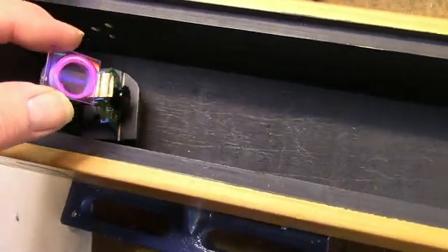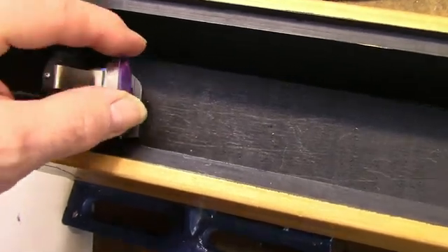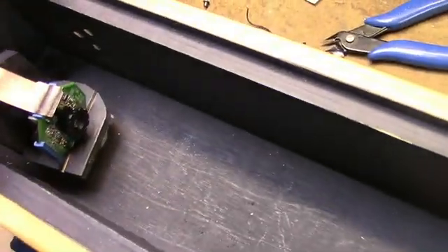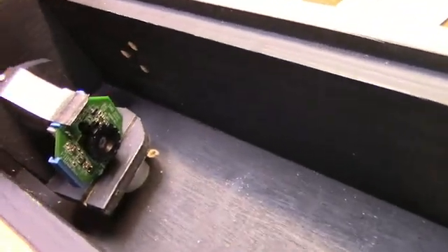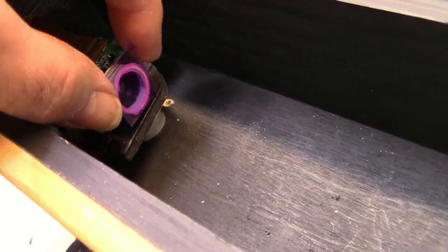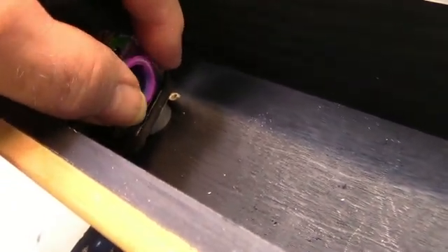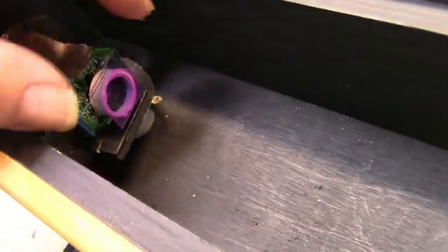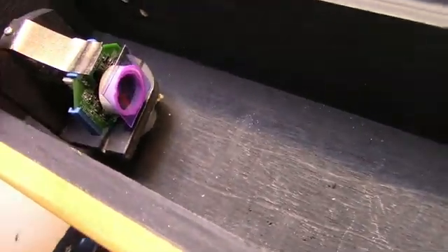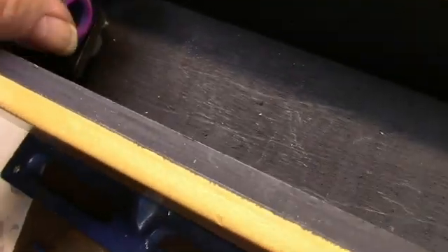The diffraction grating is glued to a small barrel that fits over the lens. You can see here. So I can rotate it. When I find the optimum position, this will be fixed in place here. So I can focus the lens and I can rotate the diffraction grating. This clamp holds the assembly down. It's adjustable.